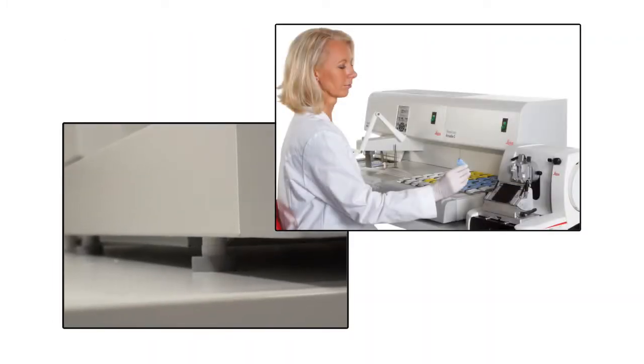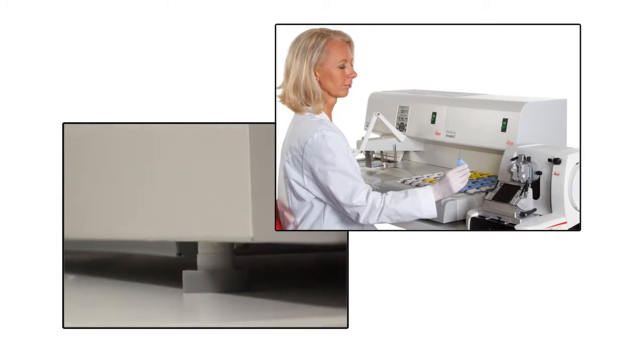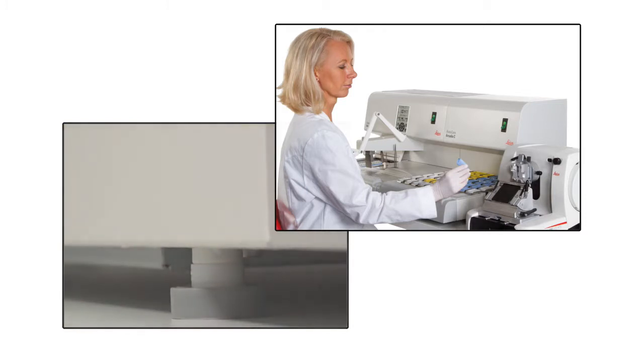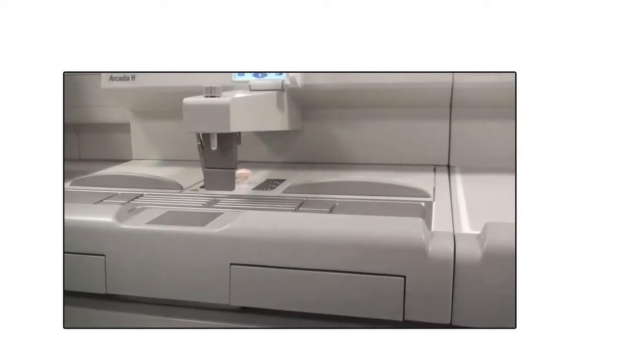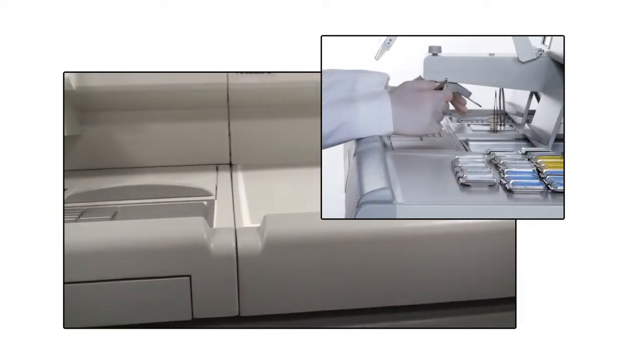For comfortable working heights, take care that the instrument is positioned in a way that permits the operator to use it without bending his head. The working surface should be leveled with the operator's elbows.